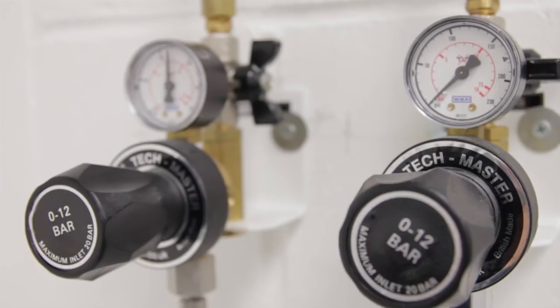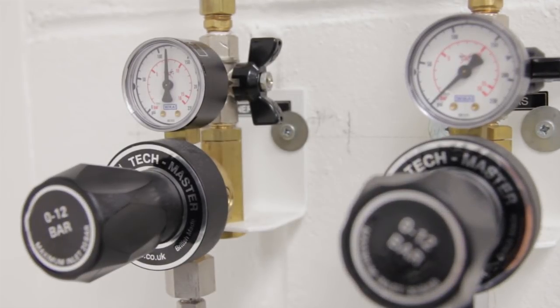As the instrument relies upon pneumatics, it is essential to ensure the gas supply connected to the instrument is regulated to 8 bar. This is 120 psi.